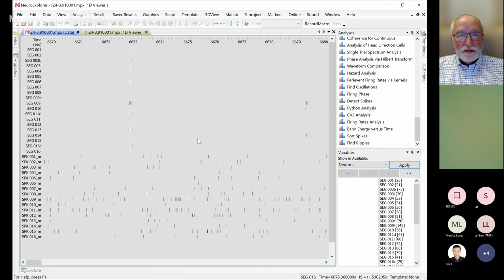I have a question here. I see there's many raster marks in the channels. Are all of them spikes? Yes, each tick mark is a spike, so it's a timestamp for the spike.